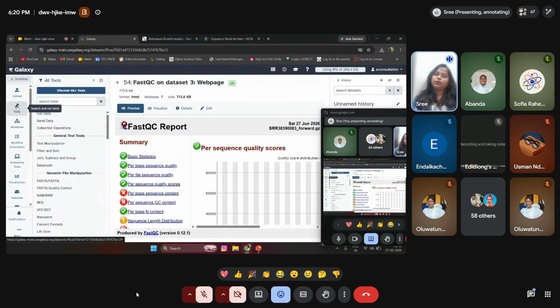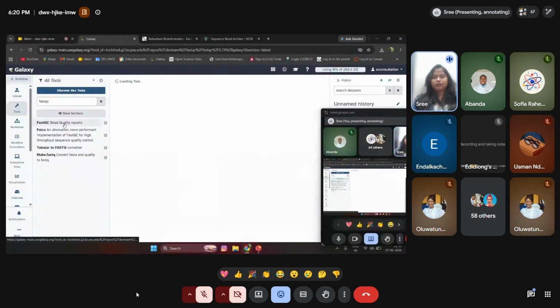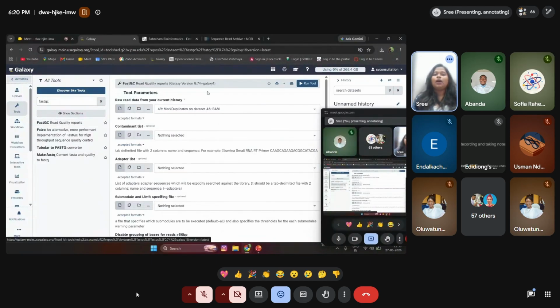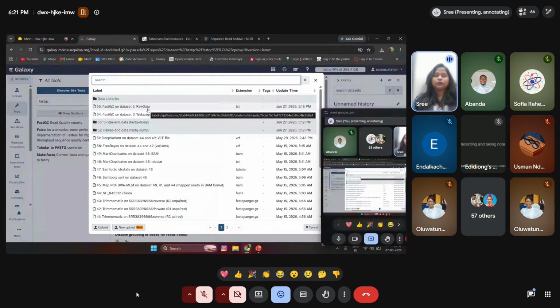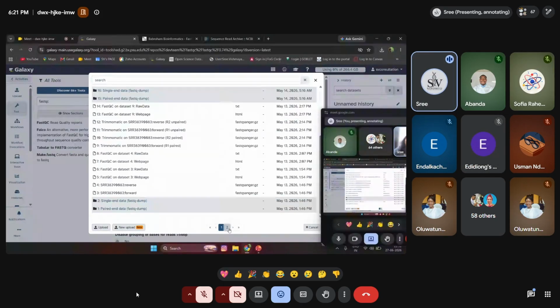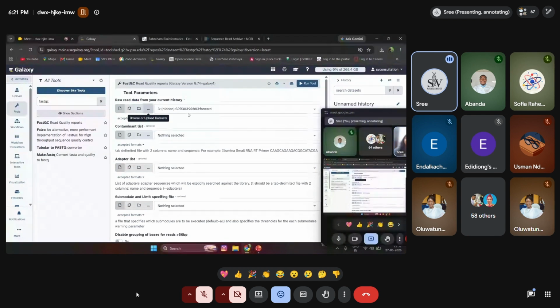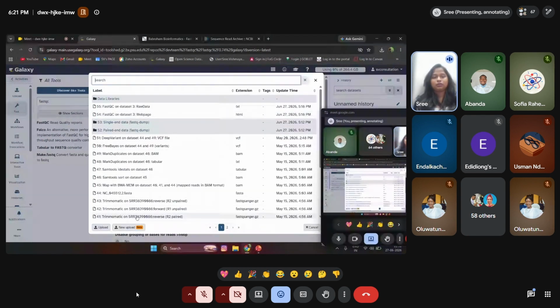Similarly, if you want to do a quality check for the reverse end, the same process, we need to go into our tools. We need to search FastQC, go into FastQC and do the same process. We need to select it. It seems our data is not uploaded yet, I think. We need to go back and upload the reverse data. So we have uploaded the reverse data, right? We have worked with the forward end data. We need to check the reverse end data. I wrongly mentioned it.